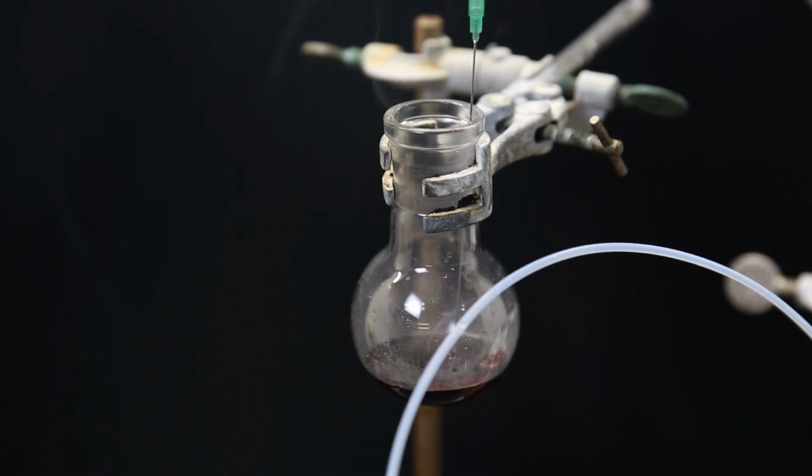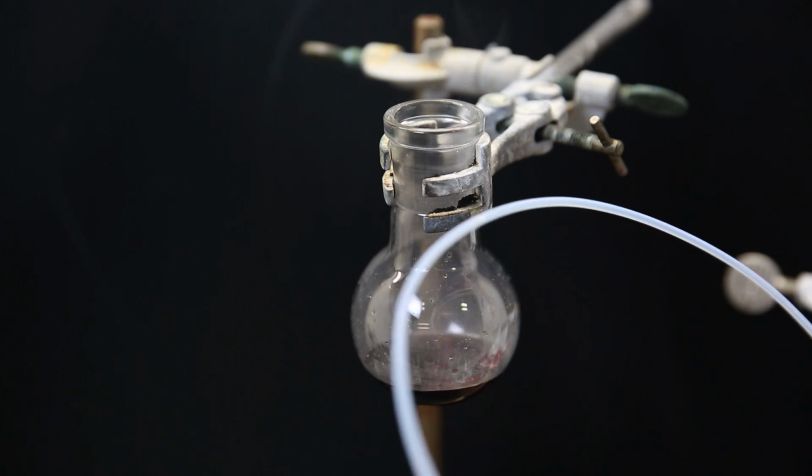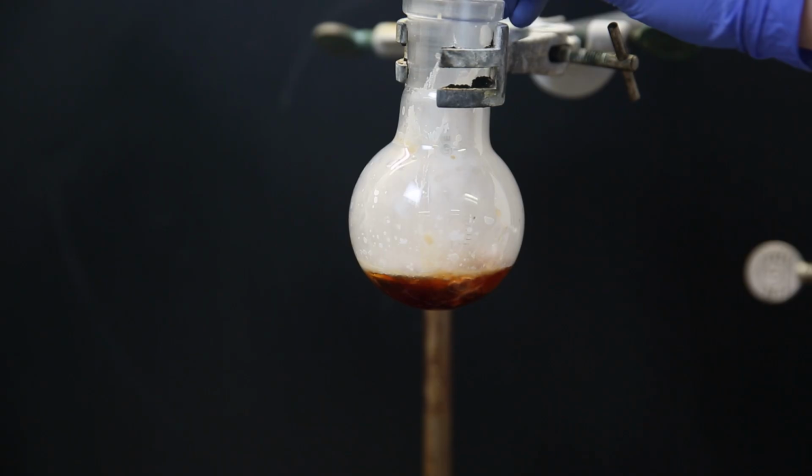At first, I thought maybe I can pass it through a needle and bubble it through, but the solid salt quickly plugs the needle. I also tried a needle with a larger borehole, which also didn't work well, and just a syringe, which was also bad.